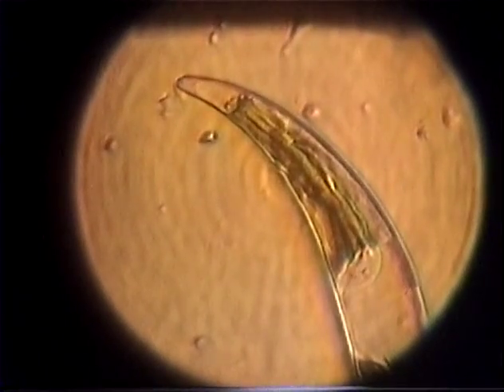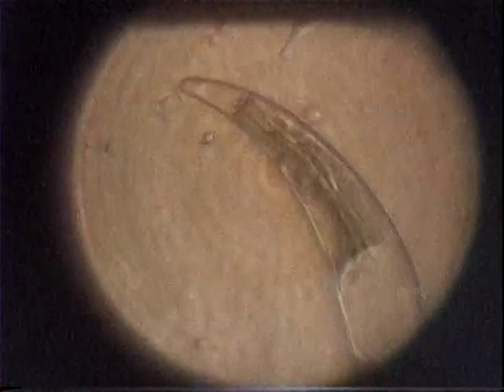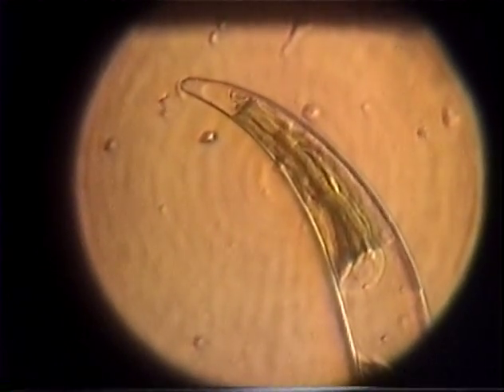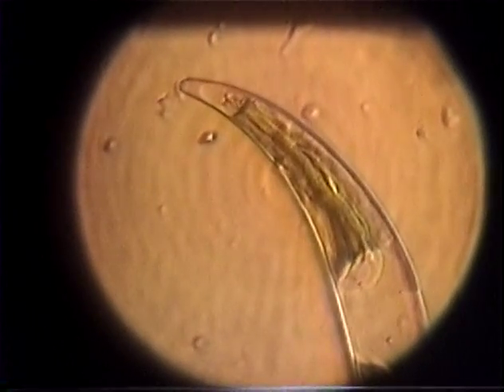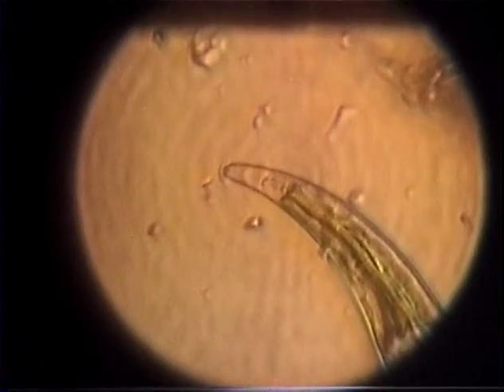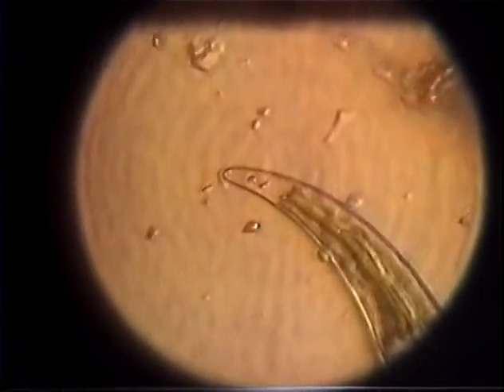Nice. All right, you guys had enough of this? We're ready to move on to the next. Which one's the next one? Next zoom. You still want to stay with these little organisms here? I want to see what those are. Top or bottom end? Top end. And I don't know if those are ends. Those might be. That's just a supposition on our part.